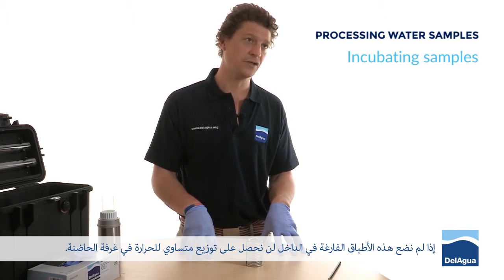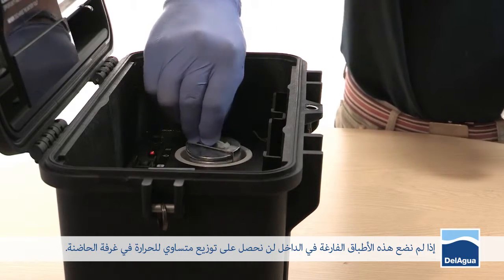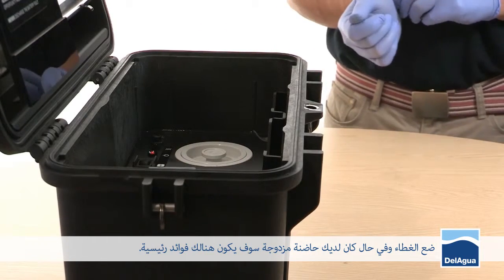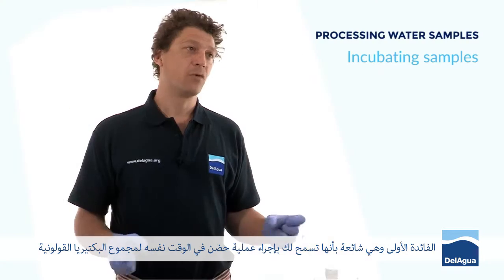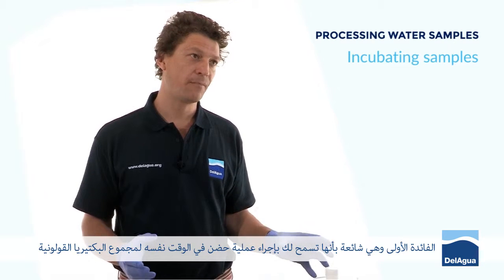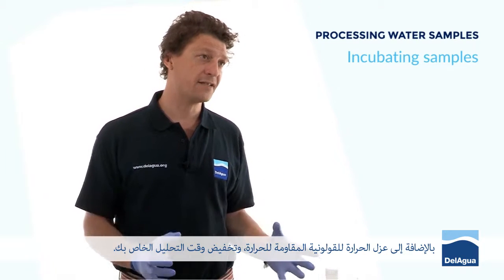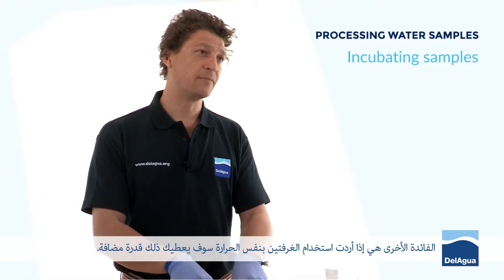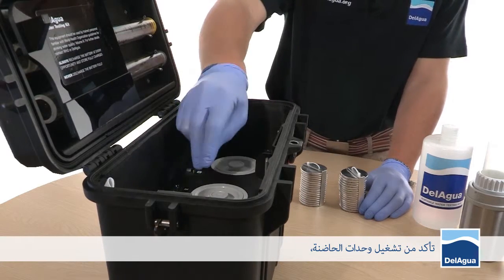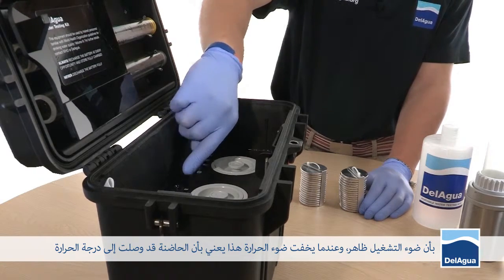Place them into the top of the incubator unit and return the lid. When using a dual unit, there are two principal advantages: the most common is that it allows you to simultaneously incubate for total coliform as well as isolating by temperature for thermo-tolerant coliforms, which reduces your analysis time. The other advantage is that if you want to incubate both chambers at the same temperature, it gives you added capacity. Ensure both incubator units have been turned on — the power light is showing and the temperature light has extinguished, indicating the incubator chamber has come up to temperature.